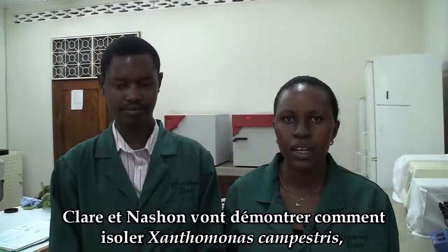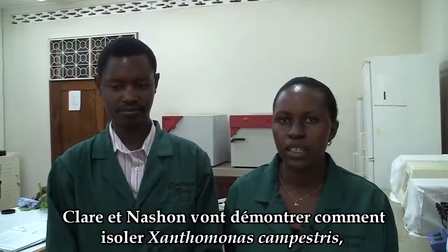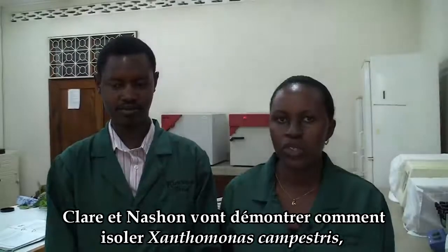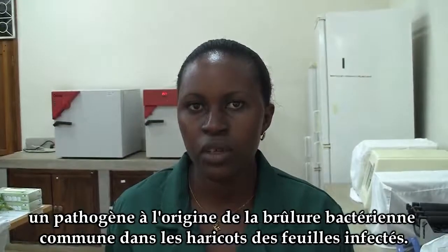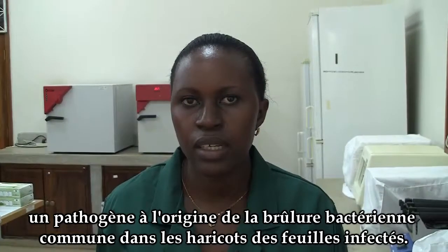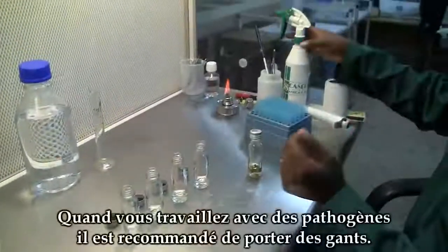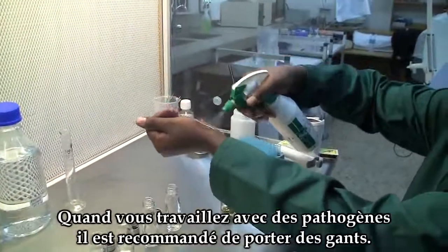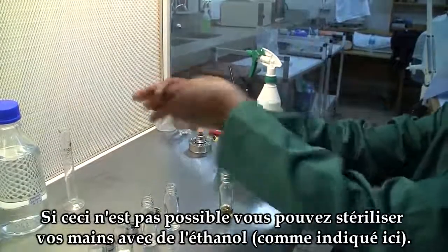Hello, my name is Claire Mokankus and together with my colleague Natha Nahason, we will be demonstrating how to isolate Xanthomonas campestris, the pathogen that causes common bacterial blight in beans, from infected leaves. When working with pathogens, you may either wear gloves or sterilize your hands using ethanol.